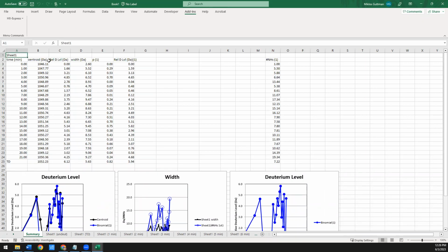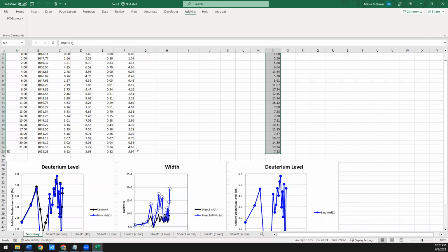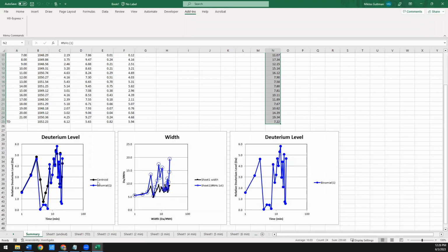So instead of just showing you the centroid up to the width, it added 2 more columns. This is the labeling probability and the deuteration associated with the binomial fit. And this is the number of amides associated with the binomial fit. And down in the plots, now it also doesn't just show you the centroid that you had originally, but now it also shows you the binomial fit. So this is your deuteration level extracted from the binomial fit. And the width also shows you the number of amides used for every one of those time points.